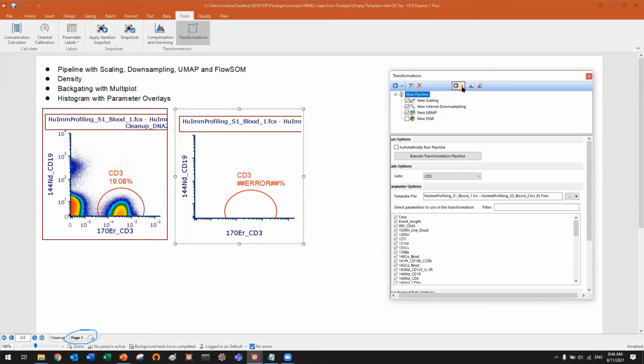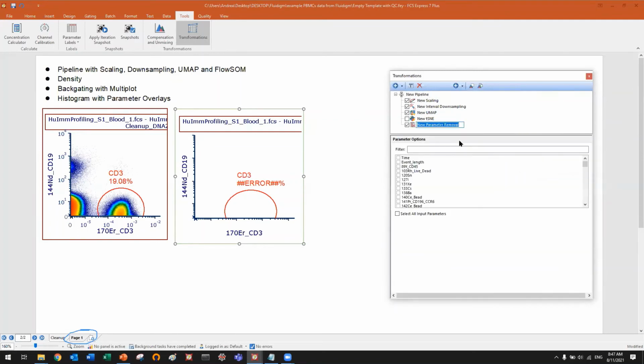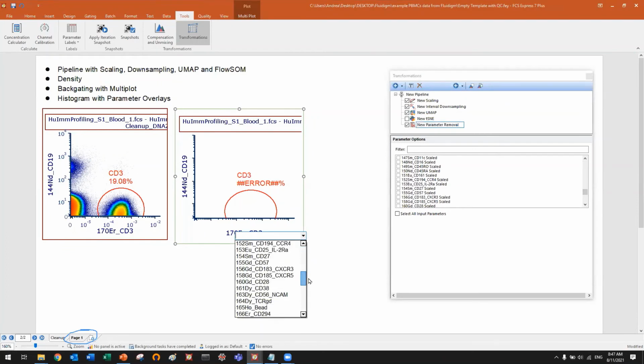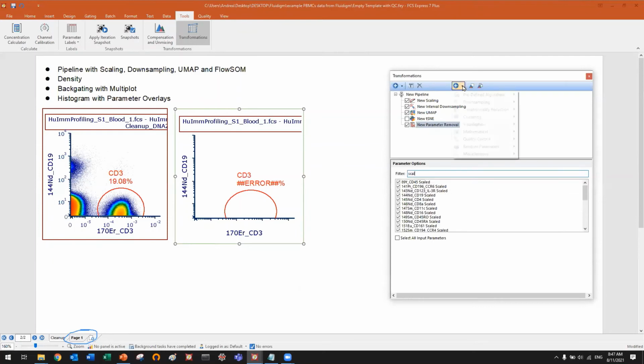It's worth mentioning that we also have a parameter removal step. What parameter removal does is hide parameters, usually at the end of the pipeline, that you don't want to see. For example, at the end of the pipeline, I will no longer need all the scaled parameters. So why should I have a huge list here when I do not really need those parameters? I can hide them. So I will just remove all the scaled data from the list. And here we go. Again, just remember you have a bunch of steps that you can combine together, a lot.